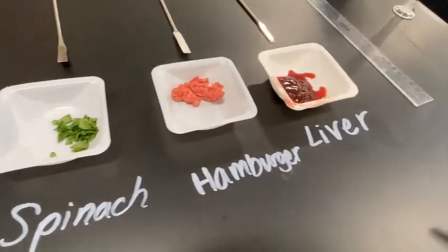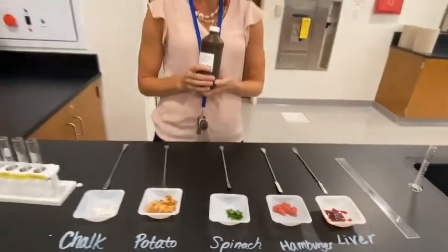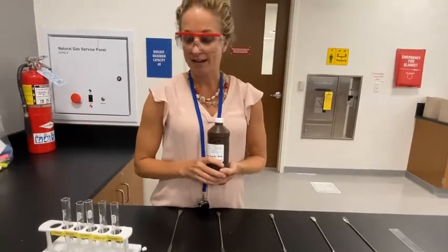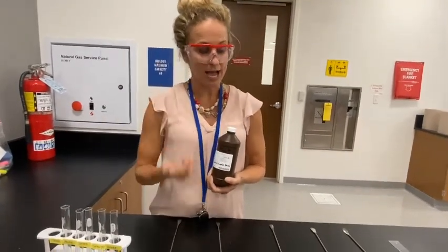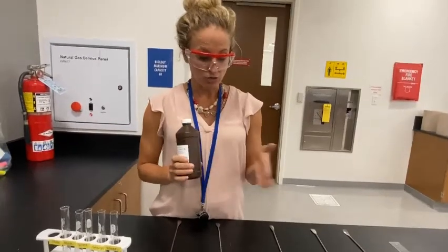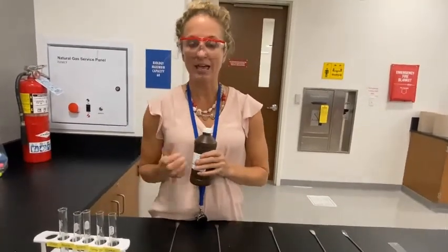When catalase works on its substrate, called hydrogen peroxide, it breaks it down, as I said, into water and oxygen gas. And oxygen gas is something that we can see when that reaction happens. We can see the bubbling and we can hear the bubbling. And so we're going to ultimately determine how much, if any, catalase is in these substances by looking at those bubbles produced.